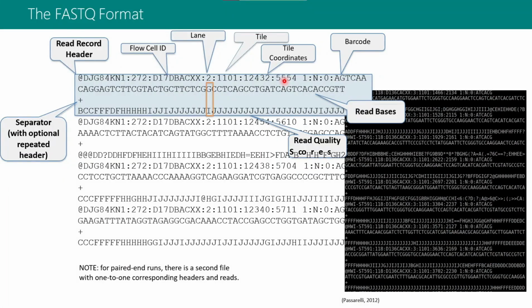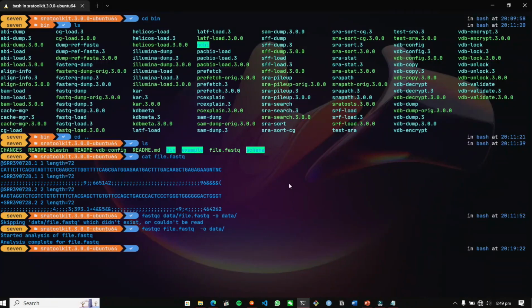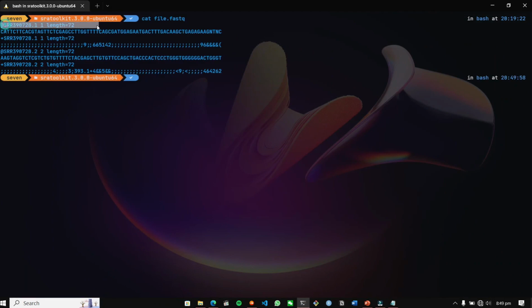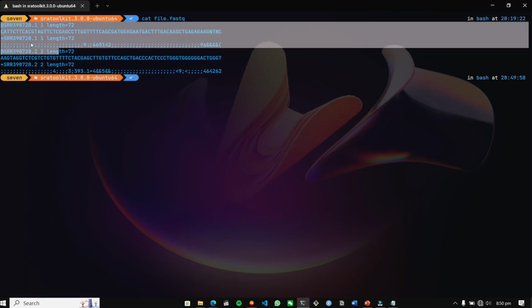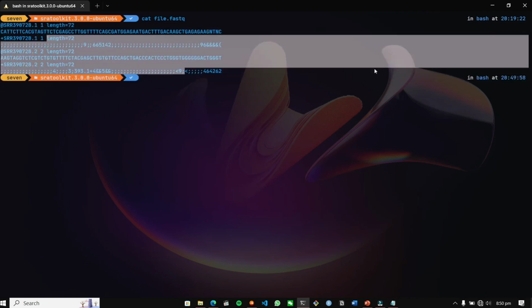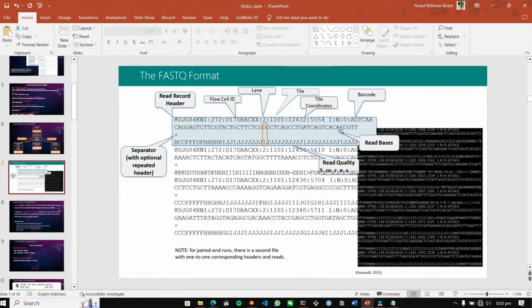First we're going to learn what a FASTQ file is, because in the last lecture we left it here. Here you can see that the FASTQ file contains reads like this. We can also visualize it in our file.fastq. Here you can see there is an accession number, there are sequences, and also the length is mentioned here.